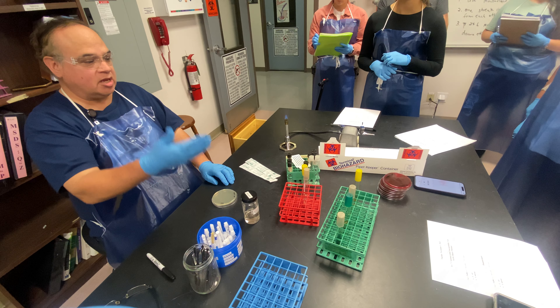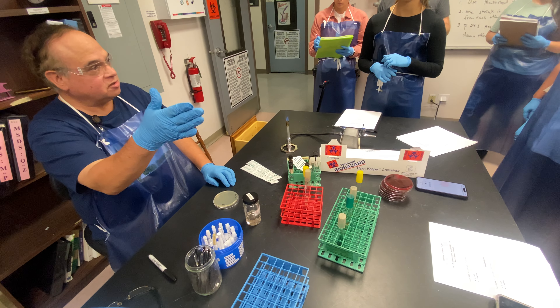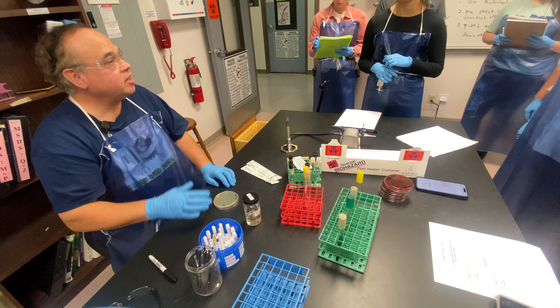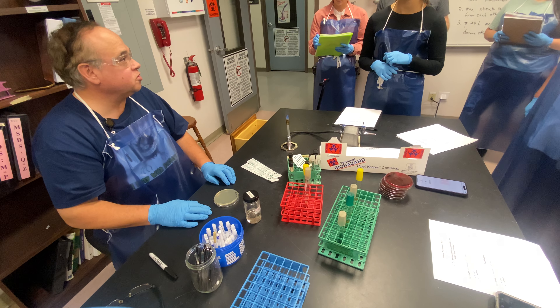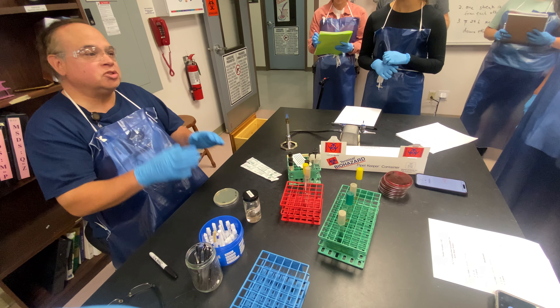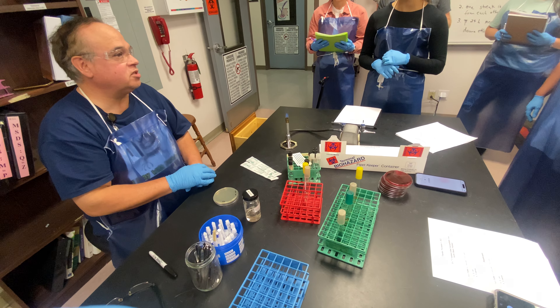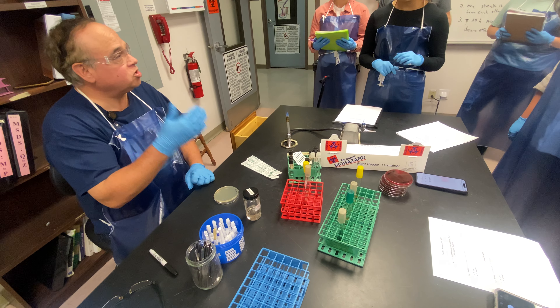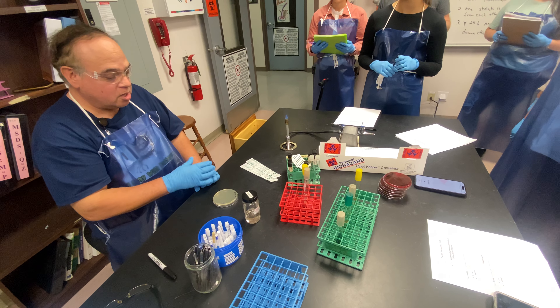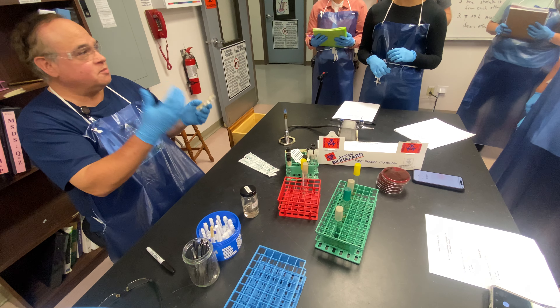Today we can either do antibiotics — there are disinfectants back there, there might even be some essential oils that you can test. You can select any of these things to do. I'm going to show you the process, and then you're going to decide how to do it. Here is just a plate.